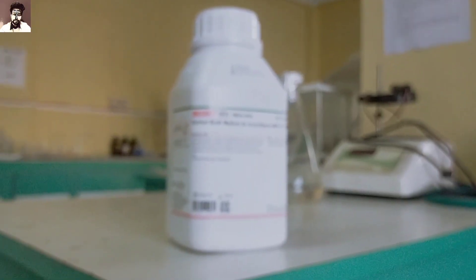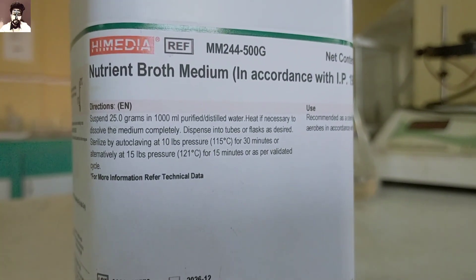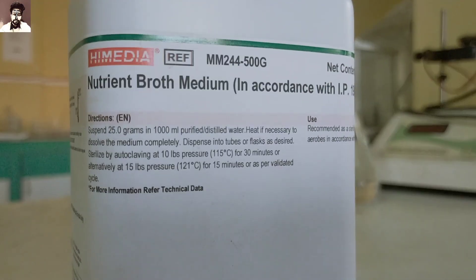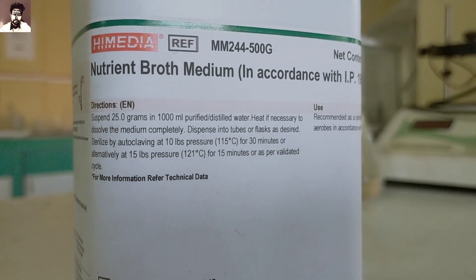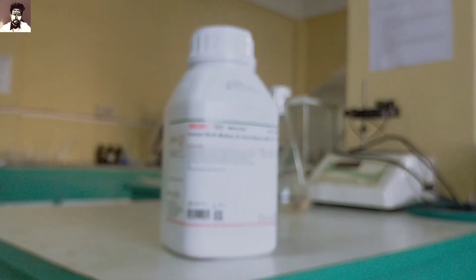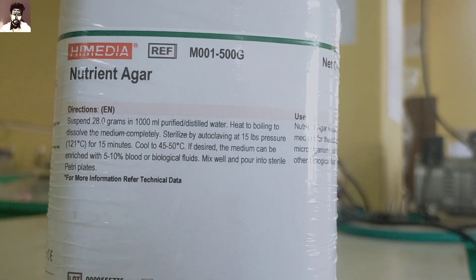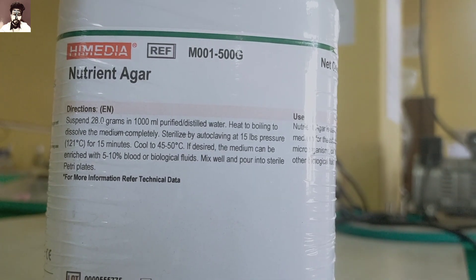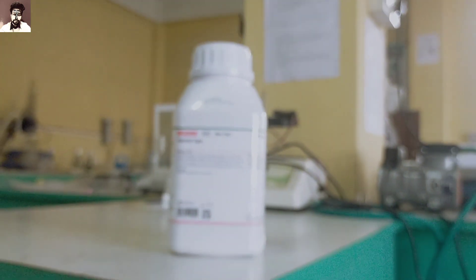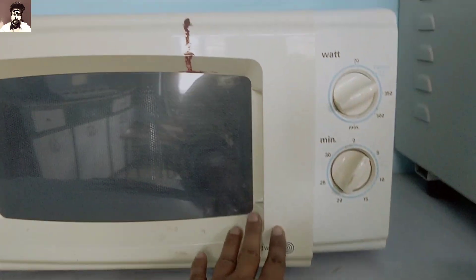I am going to show you the preparation of Nutrient Broth Medium and Nutrient Agar. For Nutrient Broth: 25g dissolved in 1000ml of purified distilled water. For Nutrient Agar: 28g dissolved in 1000ml of purified distilled water. It will completely dissolve with heat.